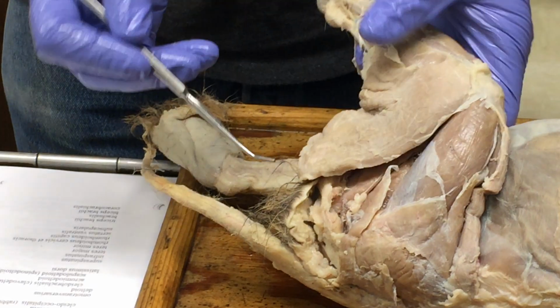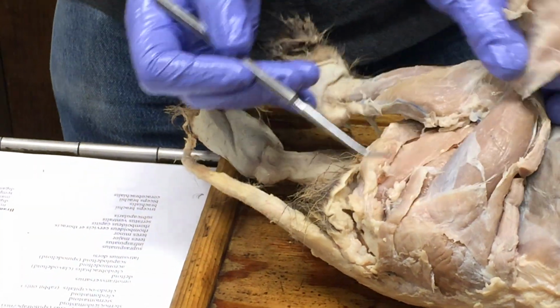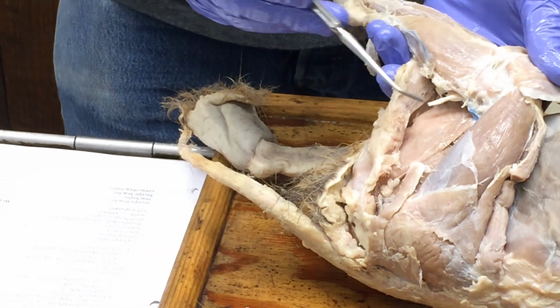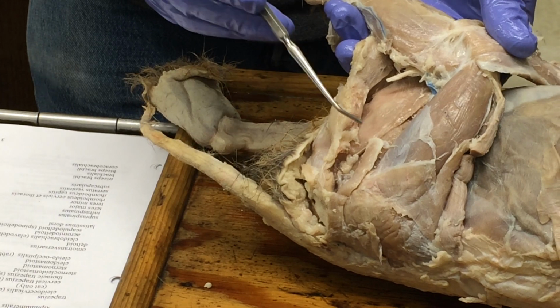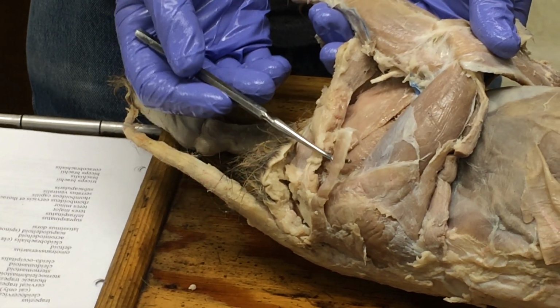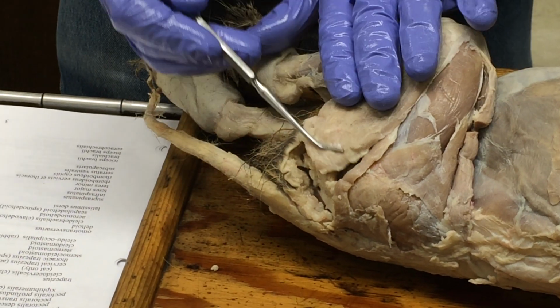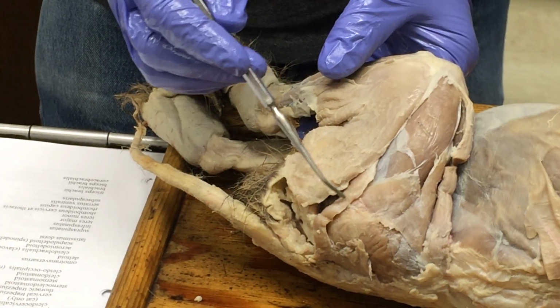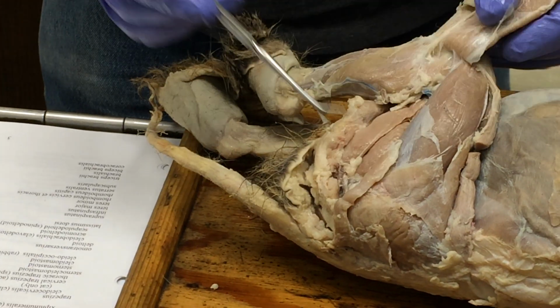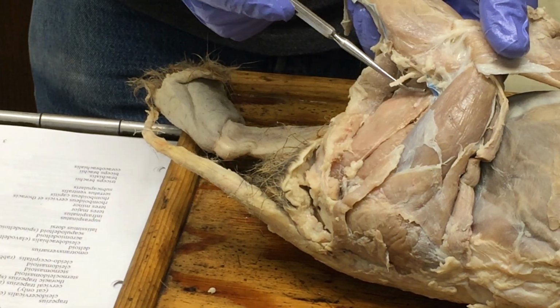And then there's another muscle that you'll see that's gotten cut off, but it had a thin sheet of connective tissue running along here. You see this at all on your phone? Your phone can see it if you can. Okay. Connecting to its tendon, this is the caudofemoralis muscle. Okay, and if we put the biceps back here, it lies just at the front border of the biceps femoris. That's the caudofemoralis, whereas semitendinosus is deep in here.